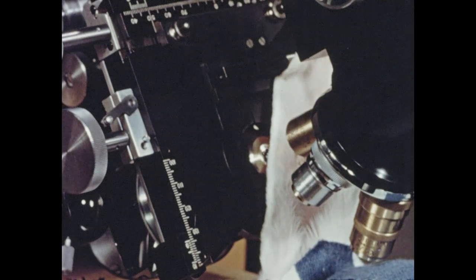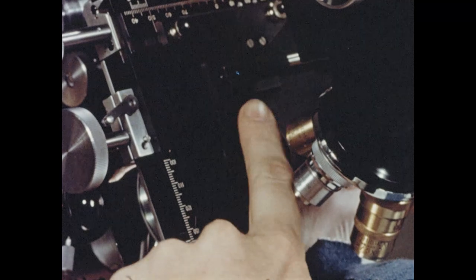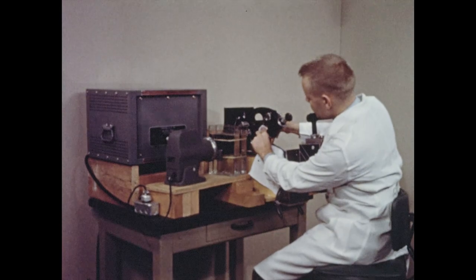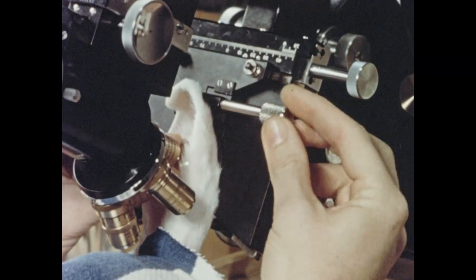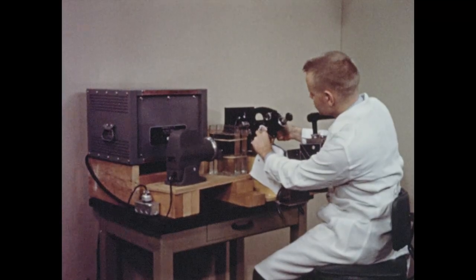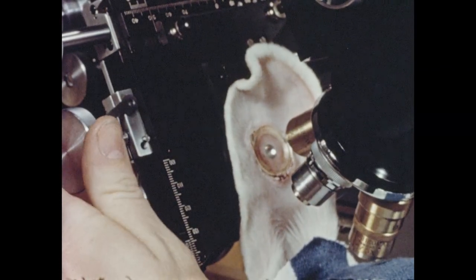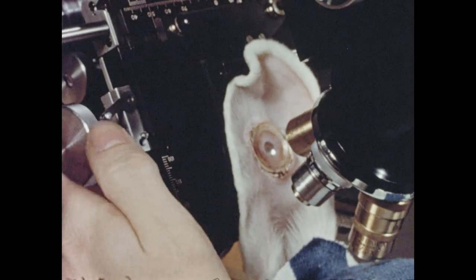The rabbit is here being placed under the microscope. The microscope is in the inverted position so that the rabbit may maintain its normal physiologic position during the microscopic observation. The ear chamber is placed in our special adaptation of the mechanical stage and clamped in position in the chamber holder. Notice that this is a calibrated mechanical stage, which greatly facilitates the repeated location of the same site for further microscopic study and photography.